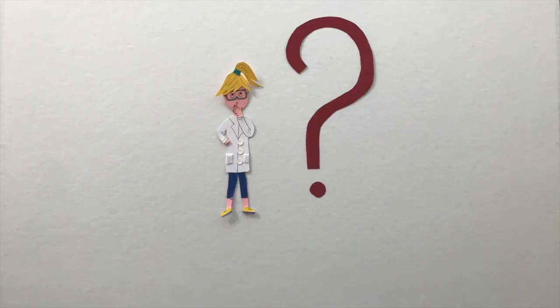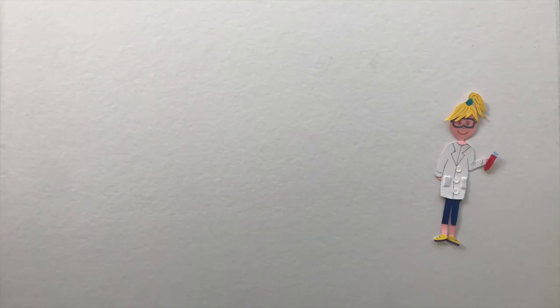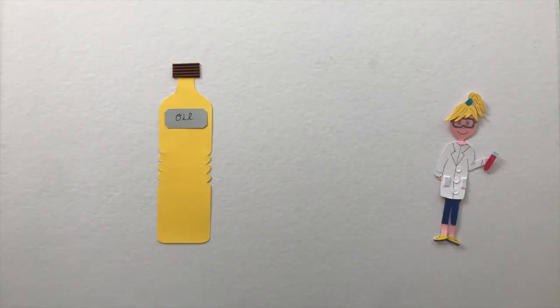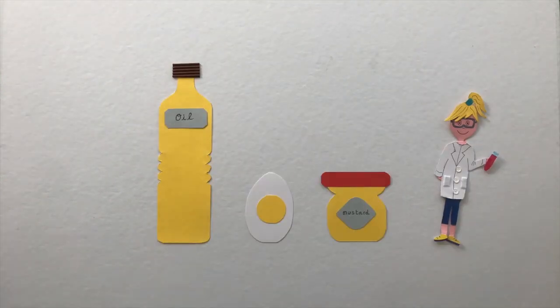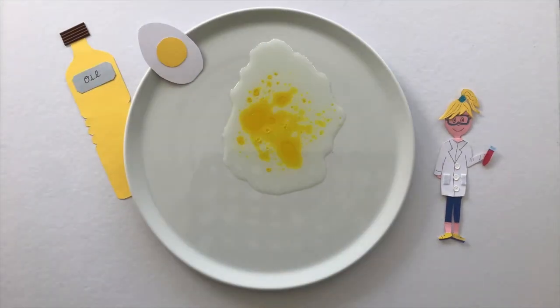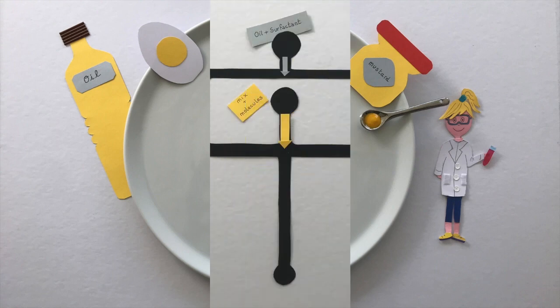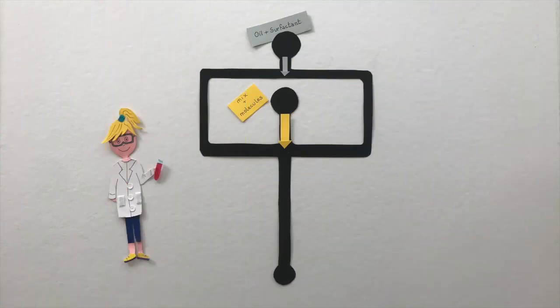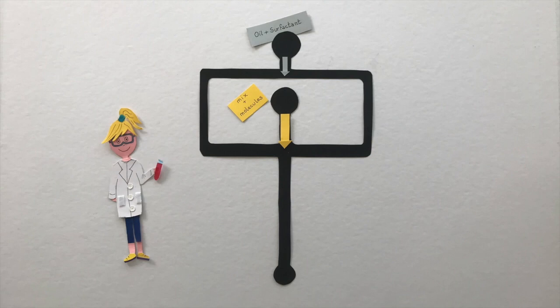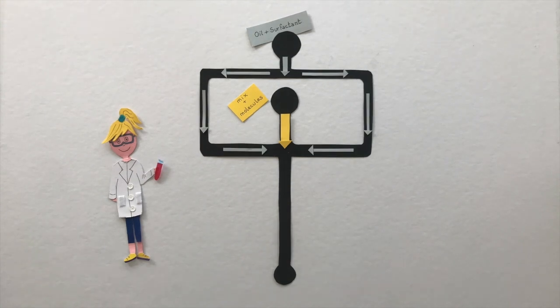But how can we produce water-in-oil droplets and keep them stable? This is exactly like making mayonnaise with oil, egg yolk, and mustard. Egg and oil are not miscible together, which is why we observe droplets of egg yolk in oil stabilized by the mustard. In our chip it's similar, but we want a more homogeneous size of droplet. Therefore we use a standardized chip device with oil and surfactant, which allows the stabilization of droplets like mustard does.